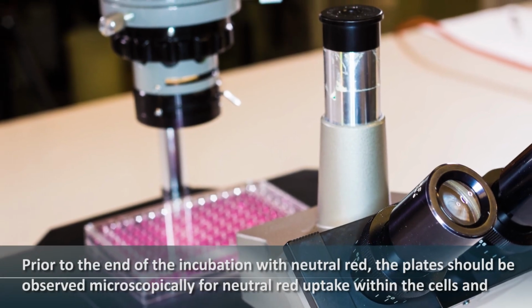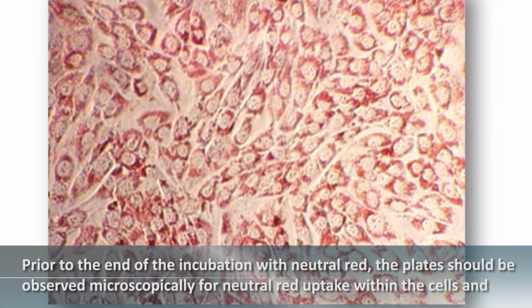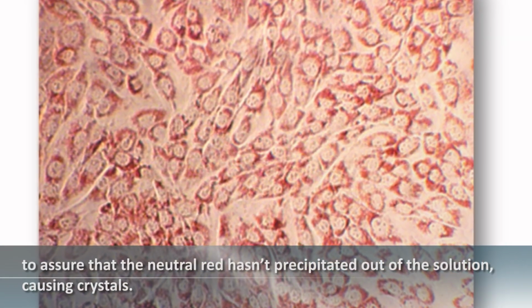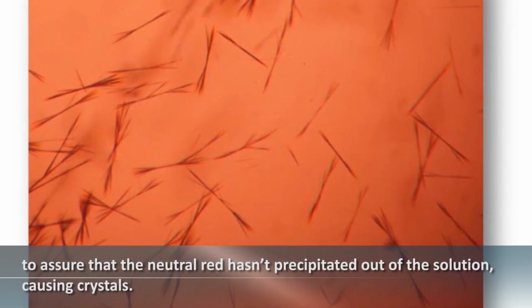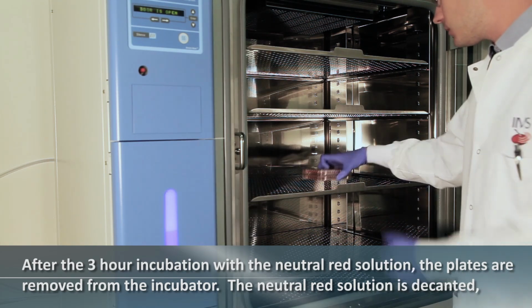the neutral red. Prior to the end of the incubation with neutral red, the plate should be observed microscopically for neutral red uptake within the cells and to assure that the neutral red hasn't precipitated out of the solution, causing crystals. After the 3-hour incubation with the neutral red solution, the plates are removed from the incubator.